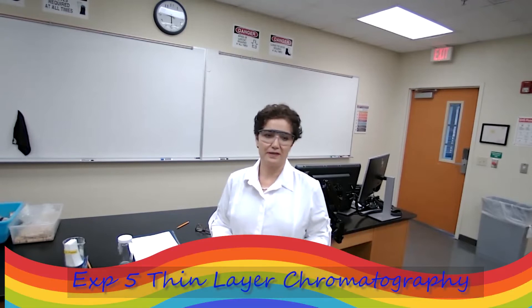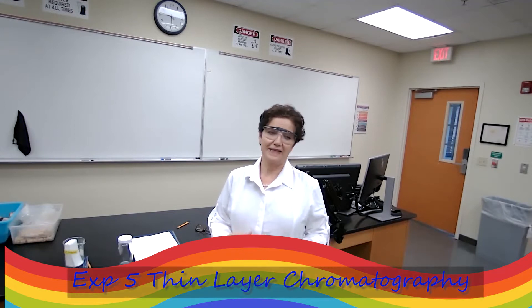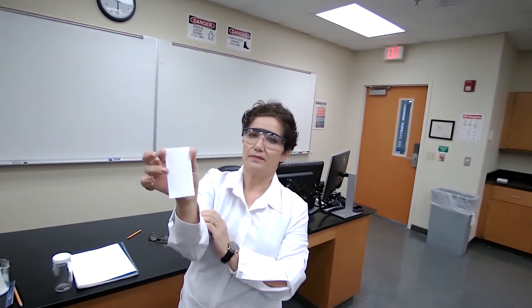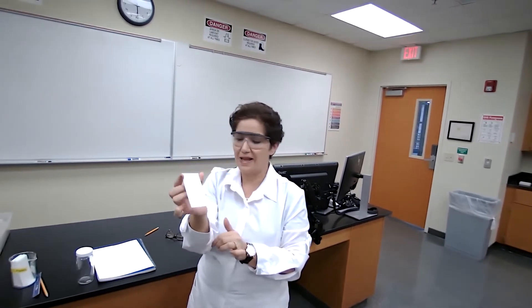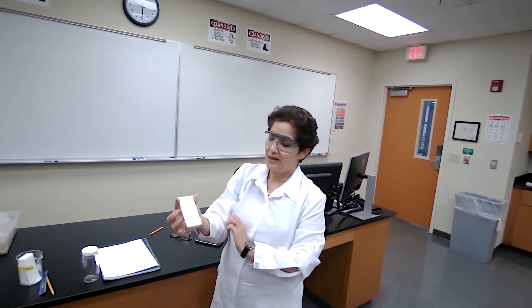The experiment today is about chromatography. Chromatography is a fast and reliable technique for separation. You can separate the components of a mixture using their difference in polarity. In chromatography we have a stationary phase and a mobile phase. The stationary phase we are using for TLC is basically alumina or silicon dioxide coated on a plastic film — it could be a glass board or plastic film.